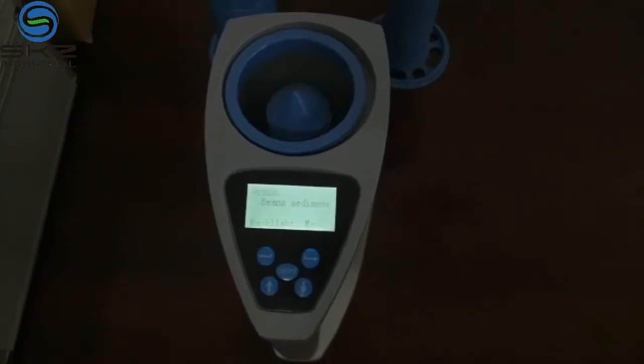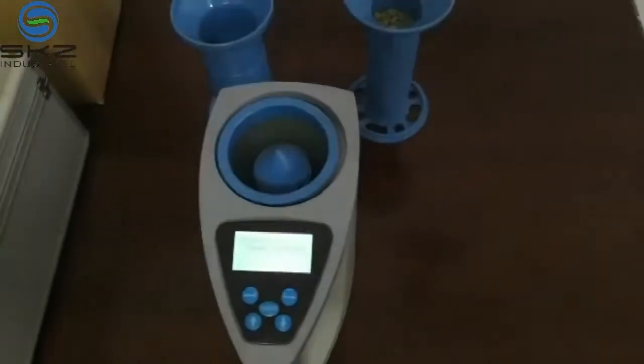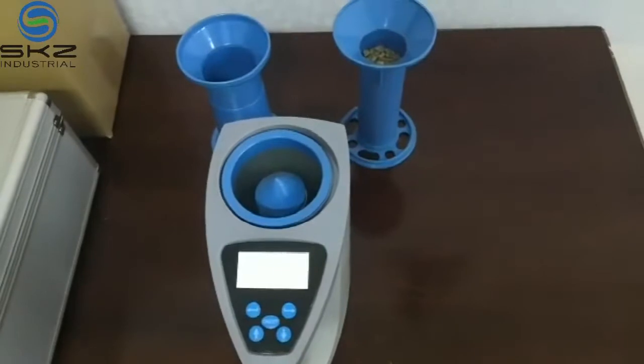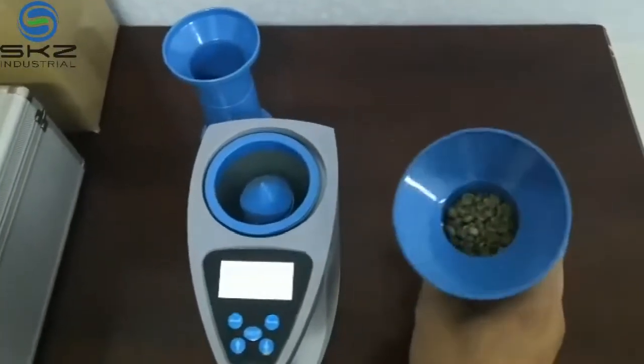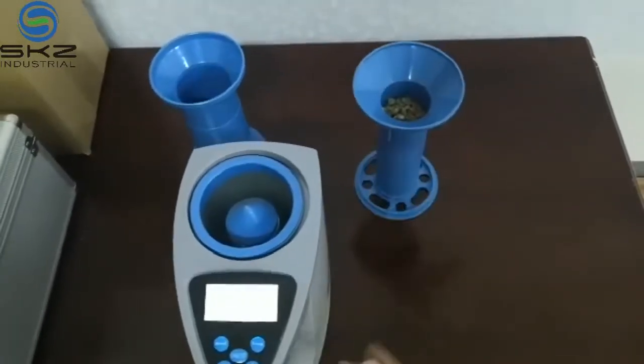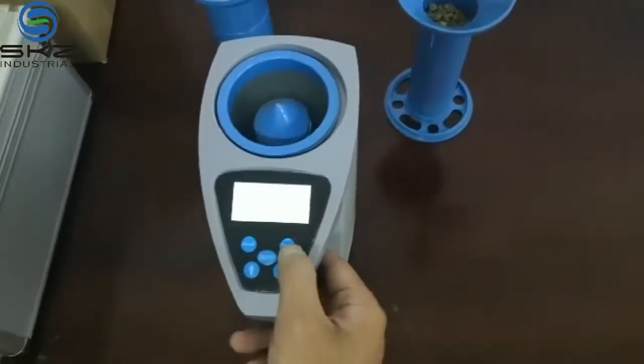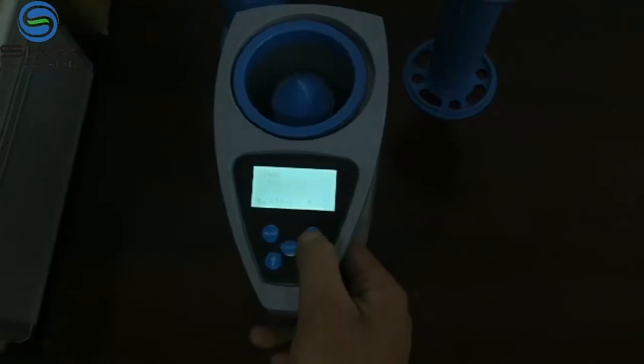Today we will measure the coffee bean moisture as an example. First, prepare the samples.